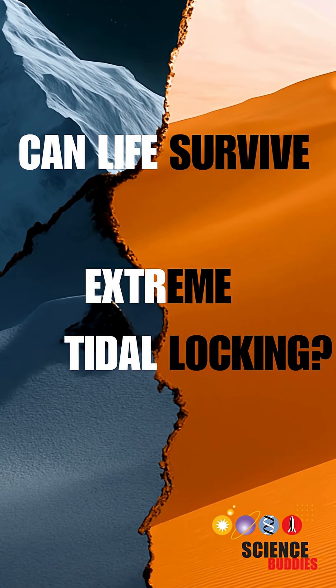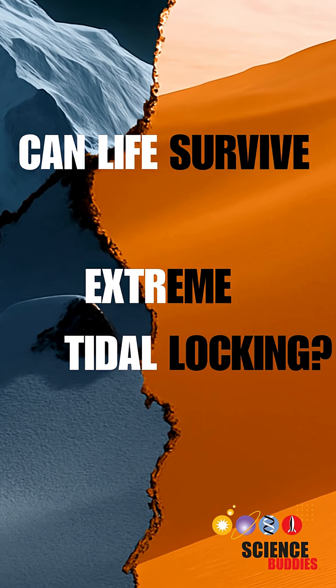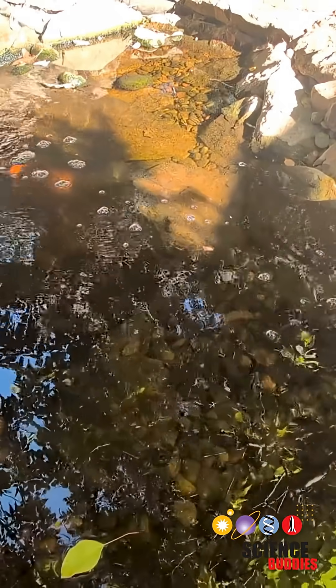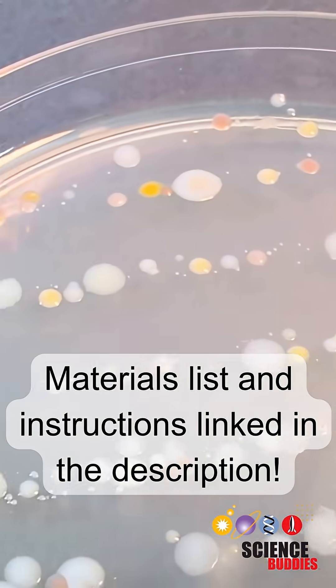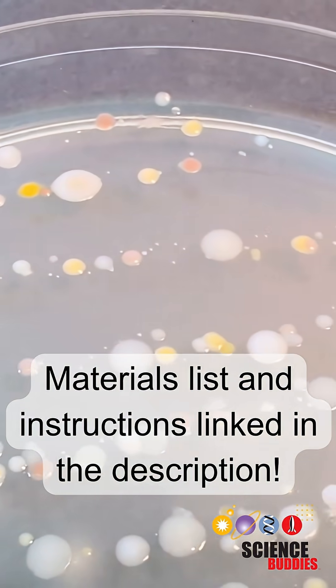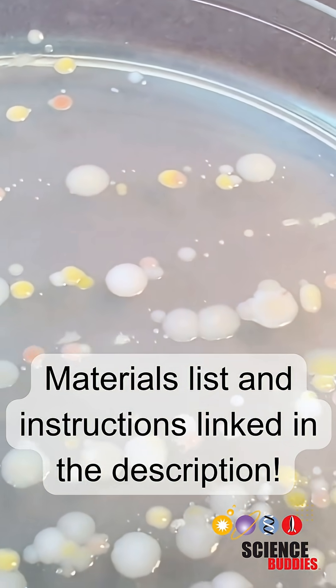In this science project you will investigate what extreme temperatures microbes can survive. You will temperature treat the microbes and then attempt to culture them on agar plates to see if there are any survivors.